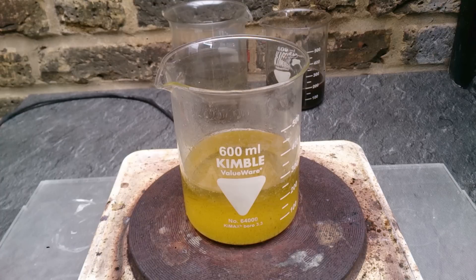Today and yesterday I did quite a few different gold precipitations. I will show you how to precipitate gold out of aqua regia using vitamin C, or in other words ascorbic acid. What you see here is aqua regia as the result of my reverse electroplating — as strange as it sounds.